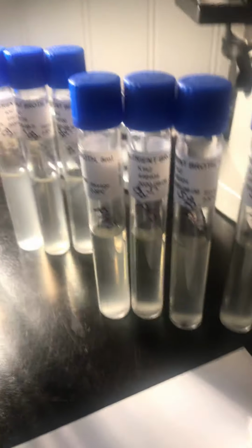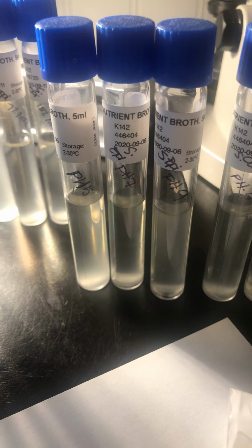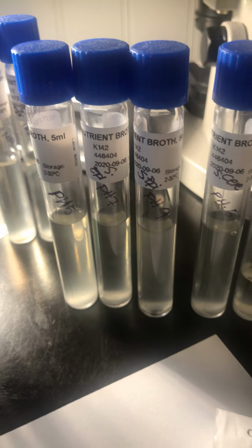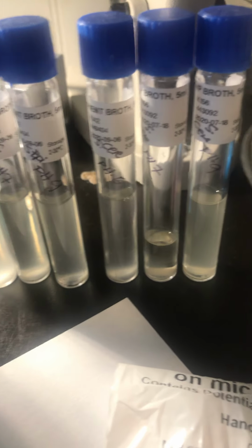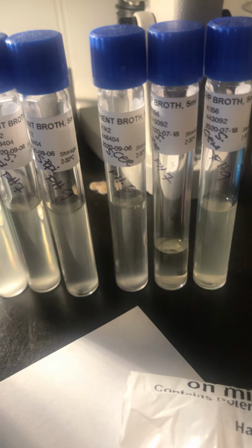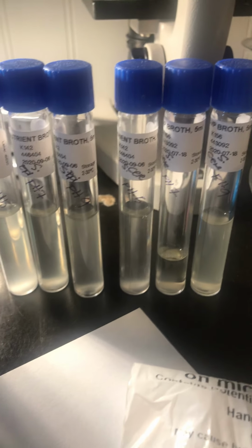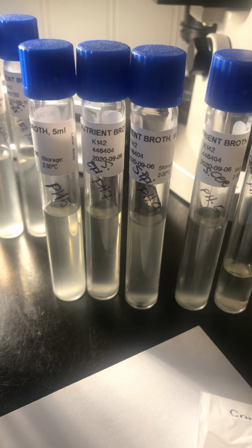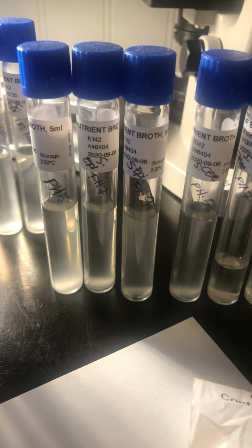This is how the tubes would look when you label them pH 5, 7, and 9, for S. epidermidis and S. cerevisiae. I would need to add exactly 1 drop of HCl to the pH 5 tubes of both S. epi and S. cere.